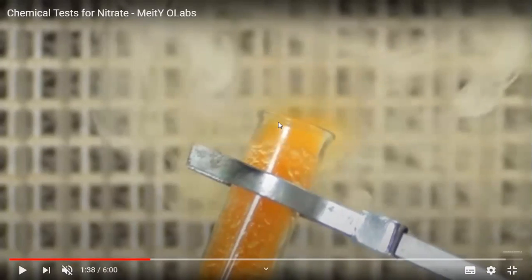Now do tell me what is happening. When we heat the salt, what happens? Reddish brown color gas is coming out. Yes, very good. Can anyone else?